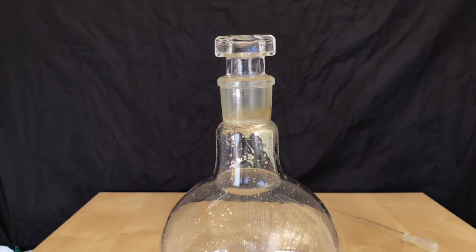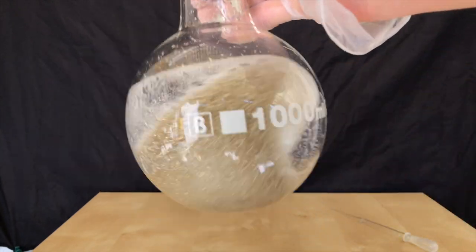It made the silver stop hanging onto the wall and we ended up with these silver flakes. The reactions taking place are relatively simple.